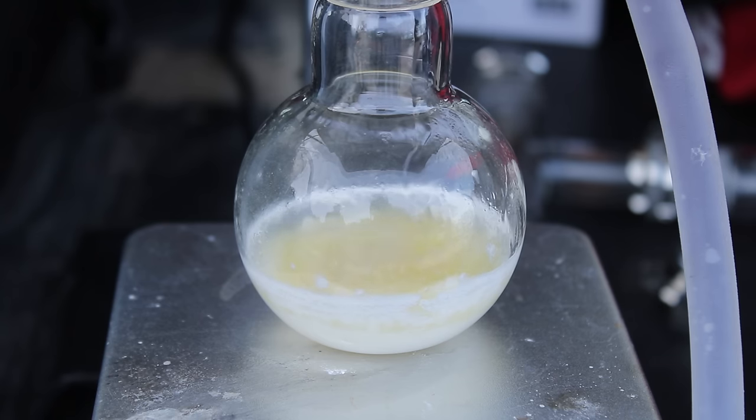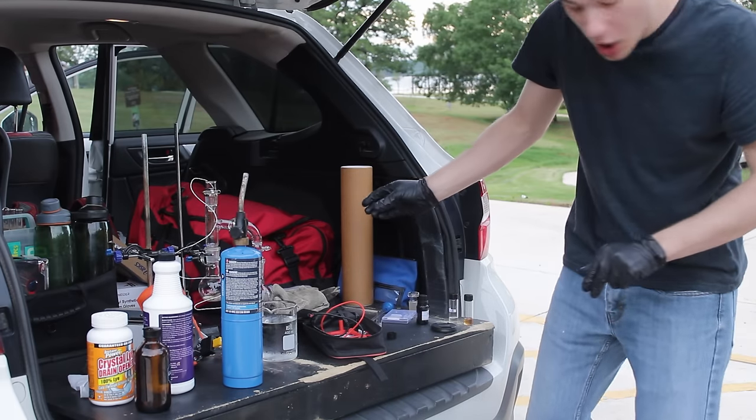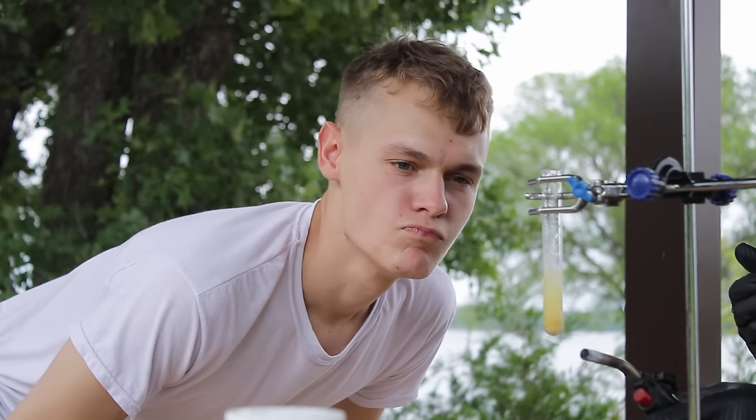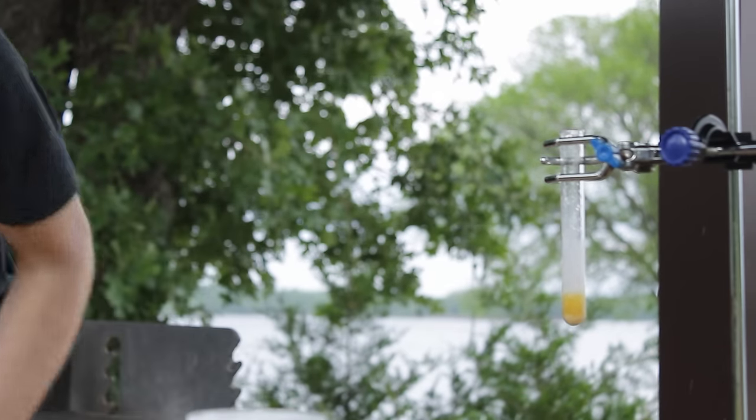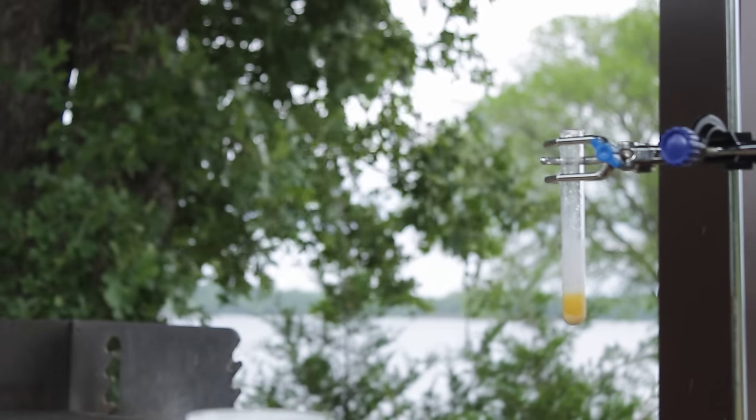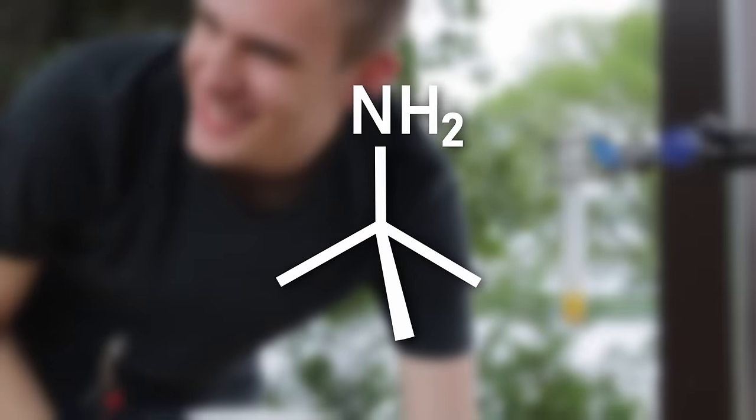And soon, I'll be showing off a new class of chemicals called isocyanides, which from my experience totally eclipse everything that I've previously tested. To get to this point though, I had to synthesize a few different precursors, and the one I'll be making today is known as tert-butylamine.